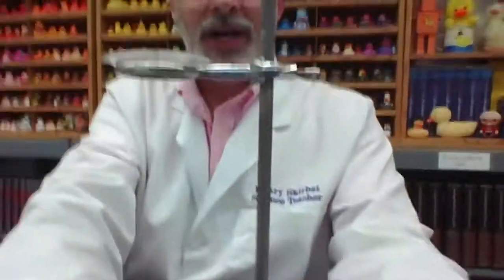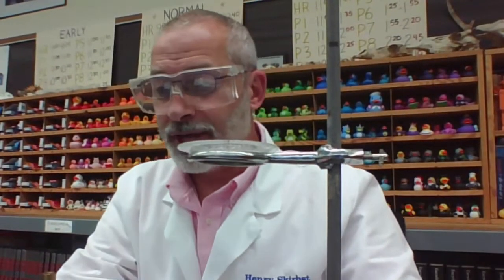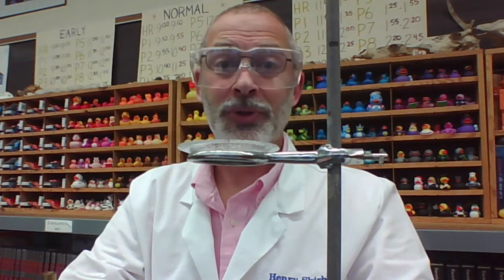Think about what that white residue might be. Think about why it's there. Think about how it got there. Think about the process of evaporation after we've gone through the decanting and filtering. So, as you are thinking about your observations, record your observations and then write a conclusion to the problem, and we'll have opportunity to discuss this lab activity.